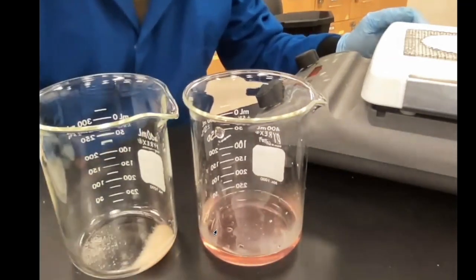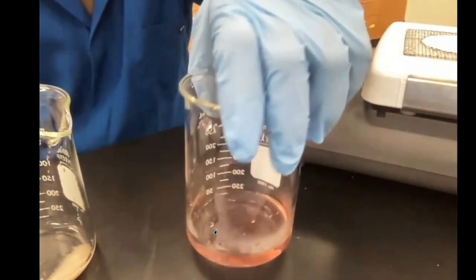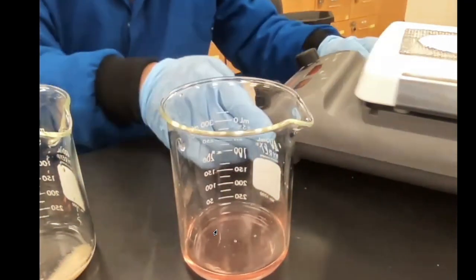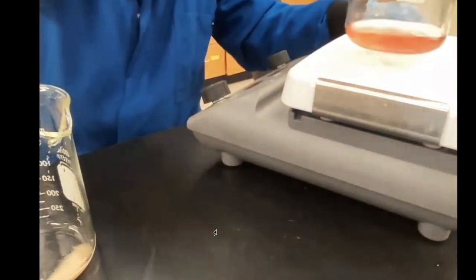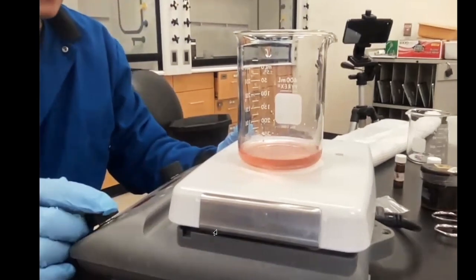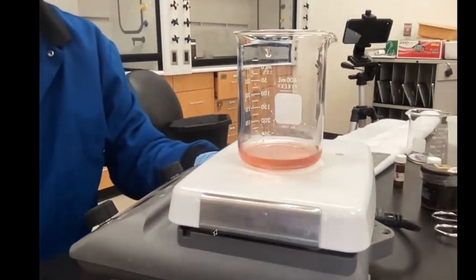Now you've got two separations. You've separated A and B. This is C, but it's not separated because it's in water. Okay, this is in water. So what you need to do next is you need to separate the water from C. And we do that by heating up the beaker, and we just allow the water to boil away. Okay, so again, this will take a little bit of time, and I just got this thing cranked, so it's going to take probably about 5, maybe 10 minutes.